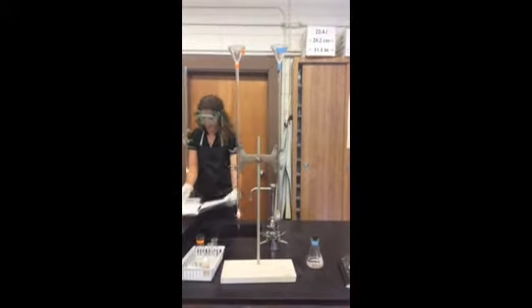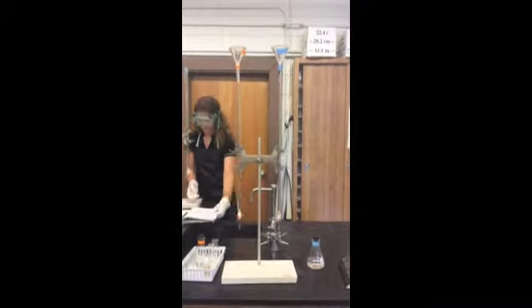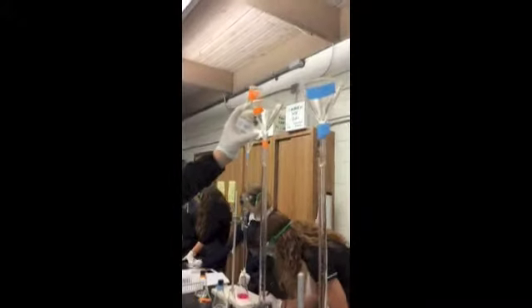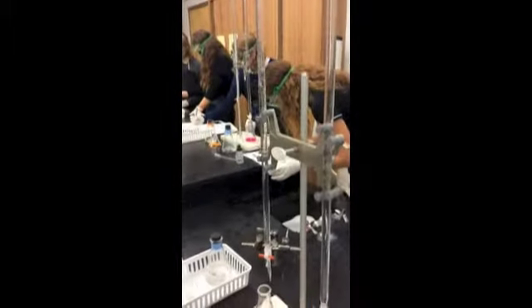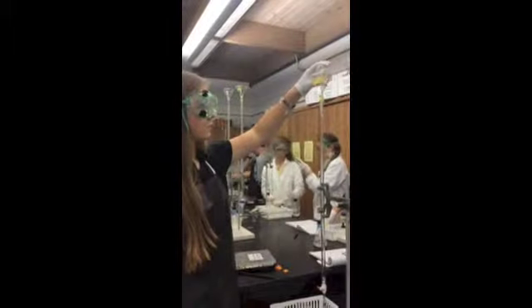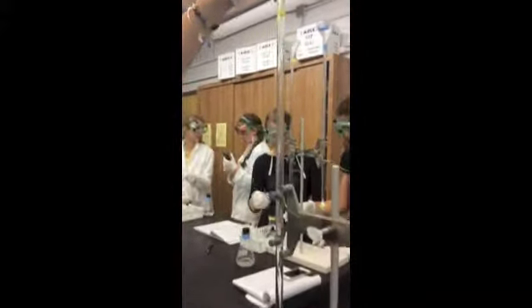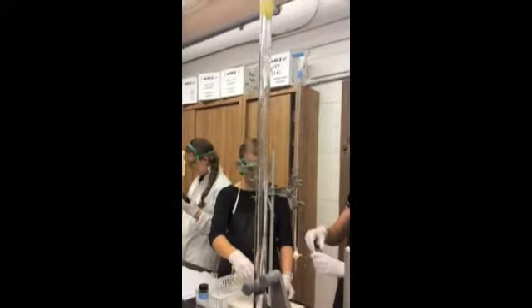Procedures. First, 2 clean burettes were set up. One was used for base and the other was used for acid. The acid burette was rinsed 3 times with the acid solution, and the base burette was rinsed 3 times with the base solution. The acid burette was filled to the 0 milliliter mark, meaning there was 50 milliliters of acid added to the burette, and this was also done to the base burette.